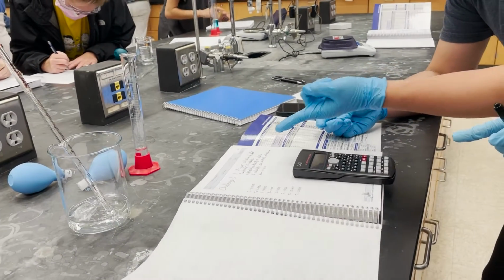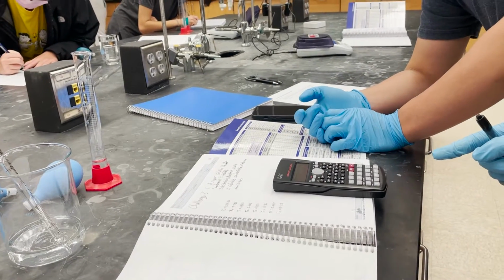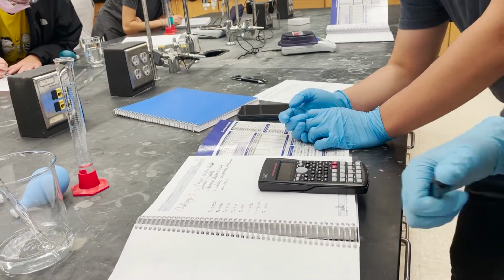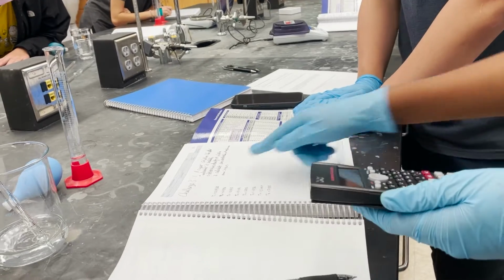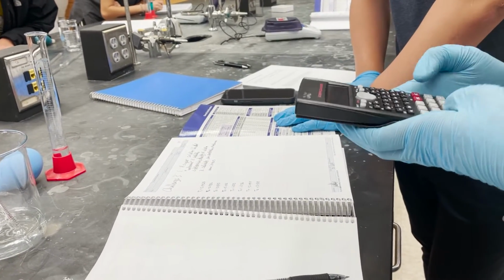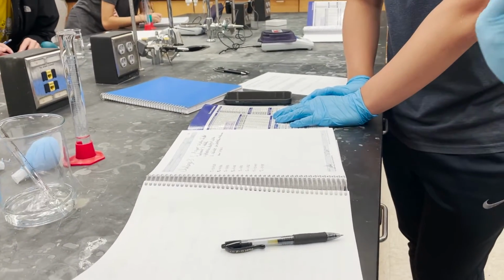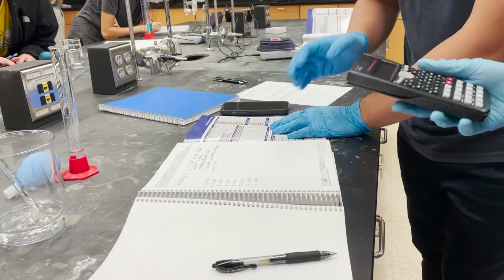I just did 0.9920 minus 0.9965. Sorry, I can start with that now. Really? This one is bad? This one is not. Okay. We get negative.